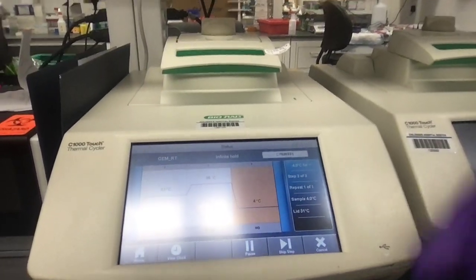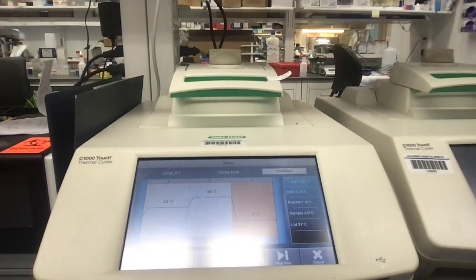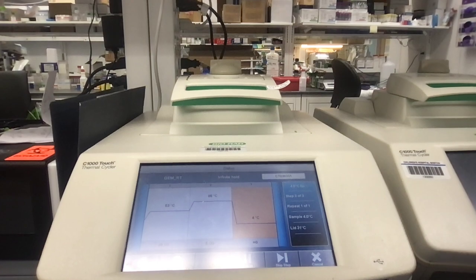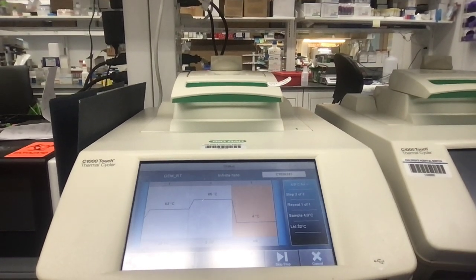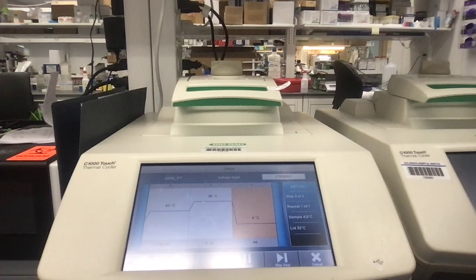There's a machine here called a thermal cycler. People use this machine to cycle through a bunch of different temperatures. That's very useful for a procedure called PCR, polymerase chain reaction, where you want to amplify a piece of DNA. You cycle through different temperatures that dissociate the DNA, anneal the DNA with certain enzymes, and then a high temperature where the enzyme works to elongate a piece of DNA.